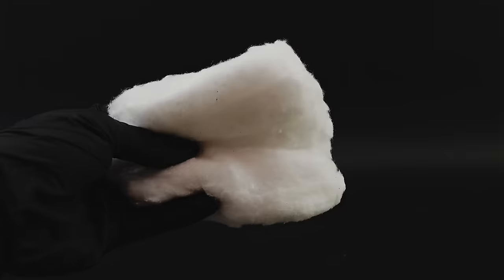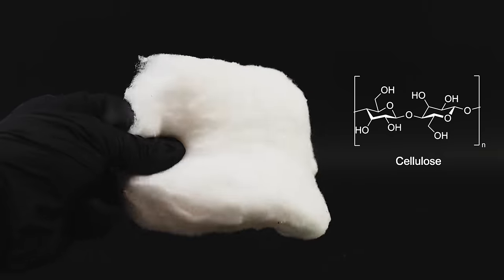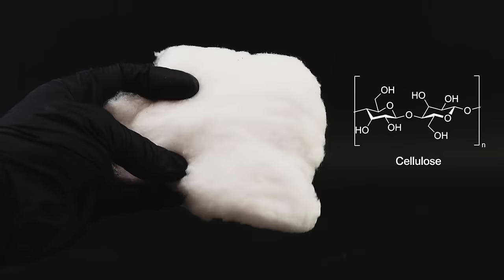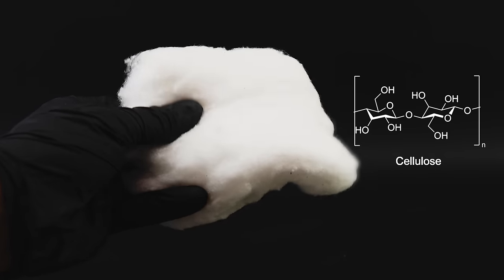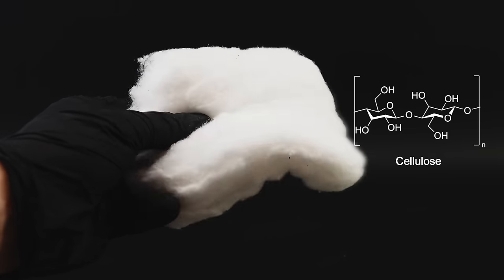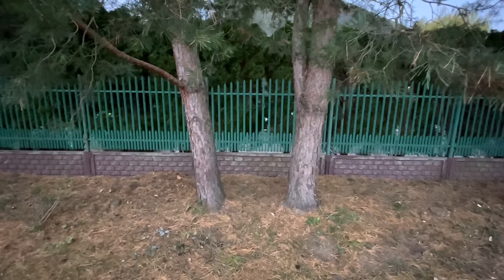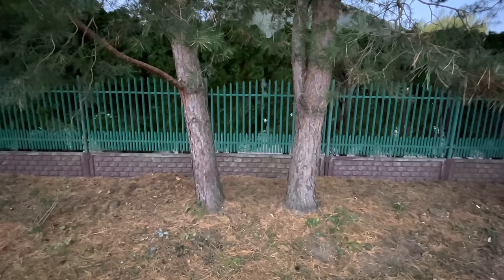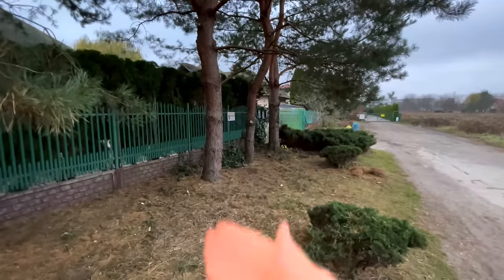This fiber, much like cotton, is based on something called cellulose, which as you might remember from biology class, is not something that grows on trees, but trees literally grow on it. This beautifully solves my accessibility problem, since trees are the definition of being everywhere, and to make some rayon, I first have to somehow steal and purify their cellulose.